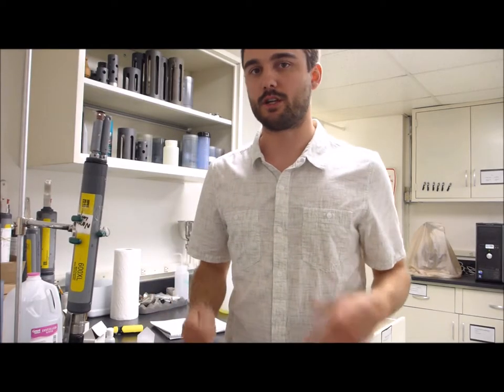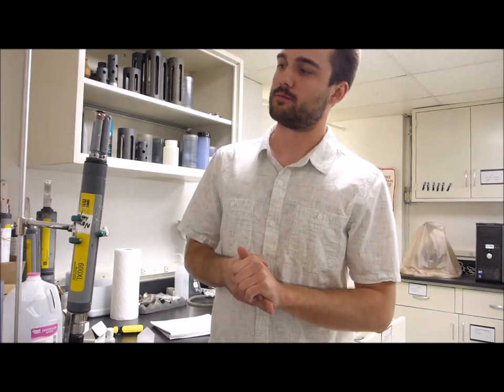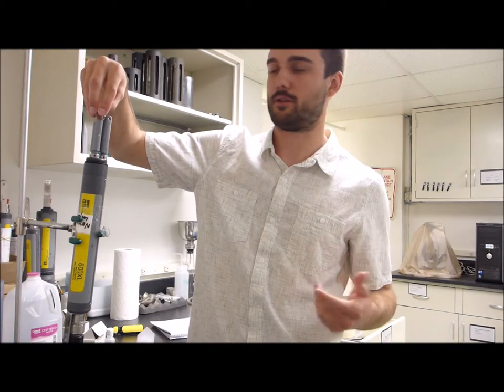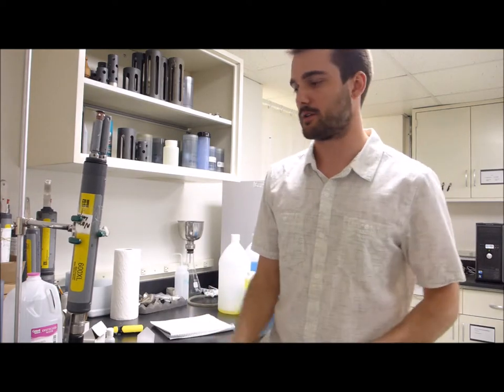Dissolved oxygen membrane is ready to go. This will help burn in while we're doing the other probes and calibrating those. So we always start with conductivity first after this.